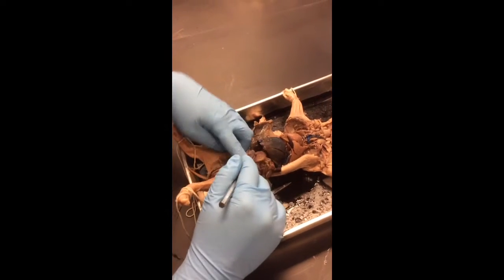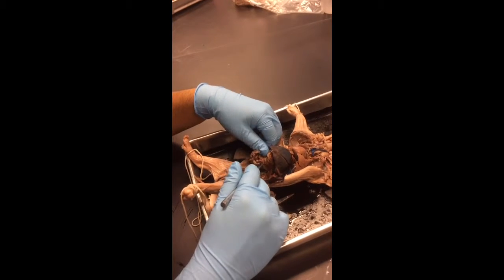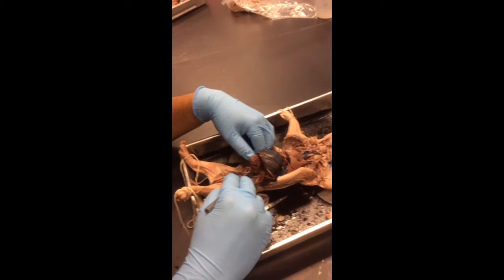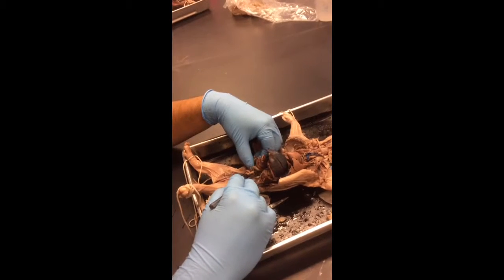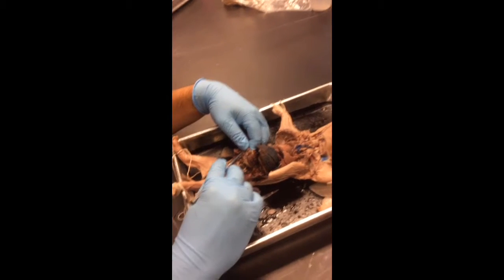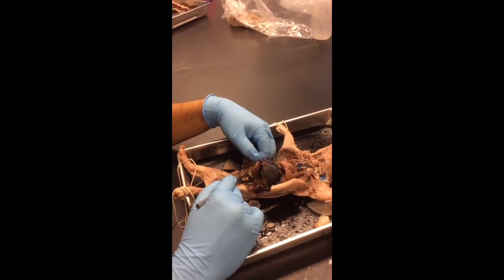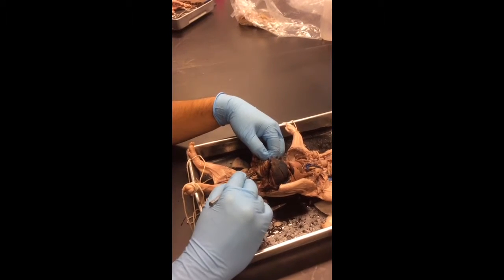The cecum. The cecum is a little bit tricky, and I probably won't put it because of that, but where the cecum is found is where the small intestine ends and the large begins. I actually found it. It's this thing right here. Where you'll see the small intestine's over here, and then the large intestine goes away, and right where that is, there's this tail-looking thing that sticks out. That's the cecum. The small intestine's here, the ileum, where you guys were looking at earlier. And here's the large intestine, and here's the cecum right here. It's kind of where the appendix would be in humans. End of the small intestine, beginning of the large, there's this outpocketing called the cecum.